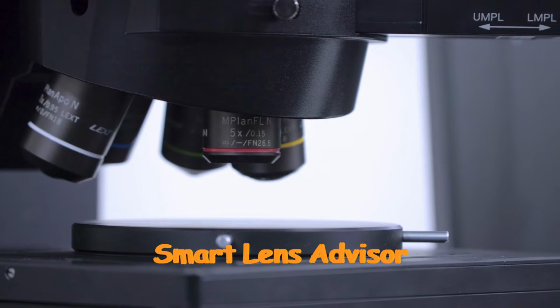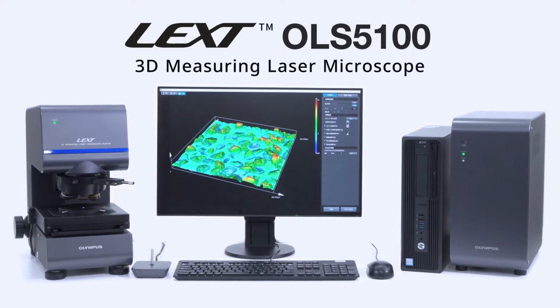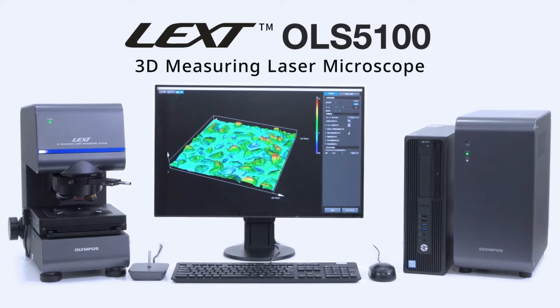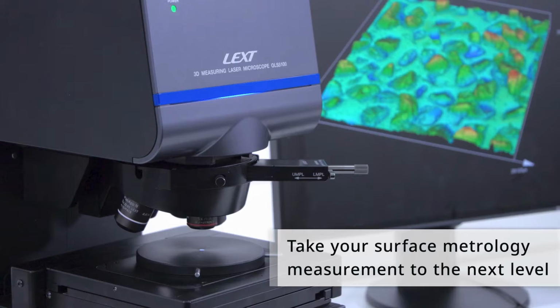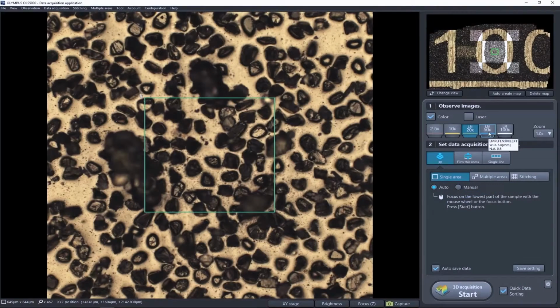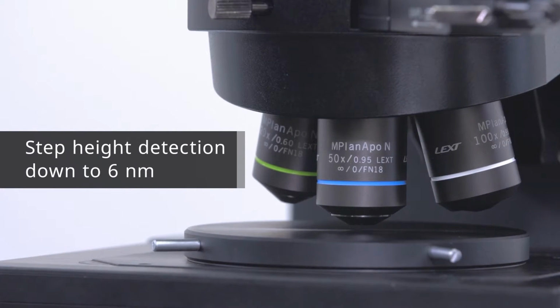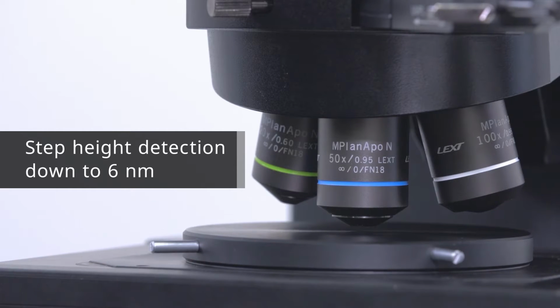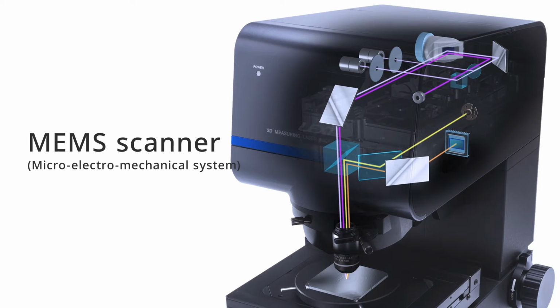The LEXT OLS5100 Laser Confocal Scanning Microscope can help you simplify your testing and measurement workflow with smart, easy-to-use features and highly accurate measurement data. Equipped with dedicated LEXT objectives designed for surface metrology, the OLS5100 laser microscope can detect a stepped height difference as small as 6 nanometers. The MEMS scanner enables the system to scan through surfaces at high resolution.